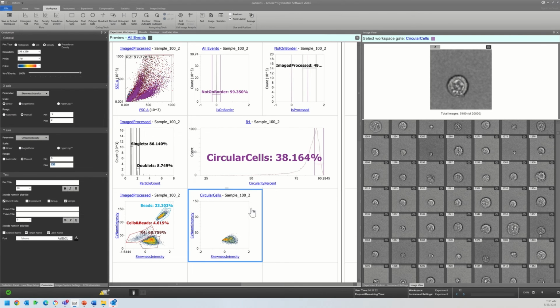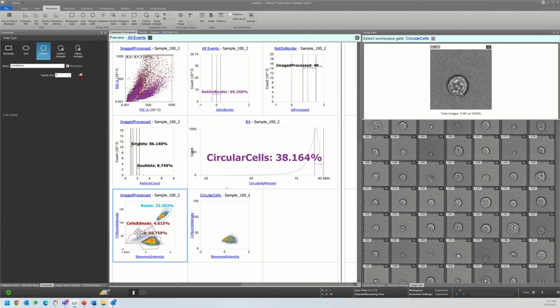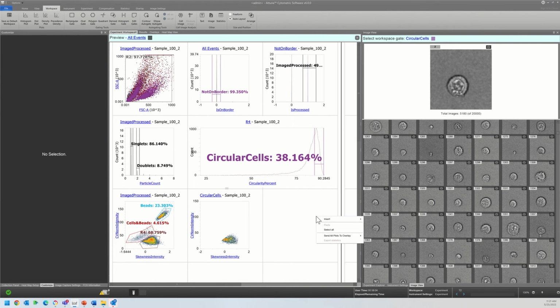And so what I would definitely caution against is using any of these as hard and fast rules. This really is sample dependent. It depends on your analysis goals. But there are a lot of ways these parameters can be used to help clean up a messy sample, to improve the downstream analysis that you would be able to do, to verify that you are working with particular populations, and especially to really tease out the nuance between the coincidental events, the interactions, and overall improve the level of resolution that you can achieve.